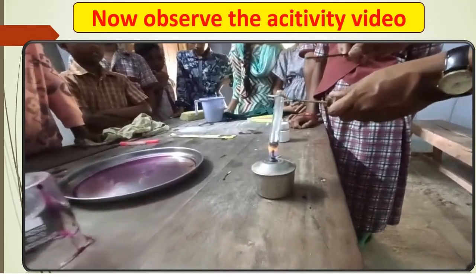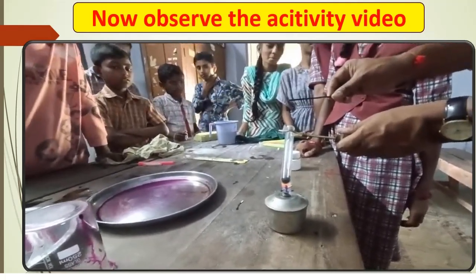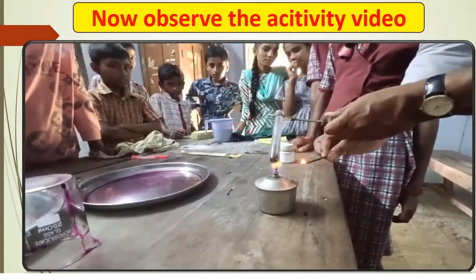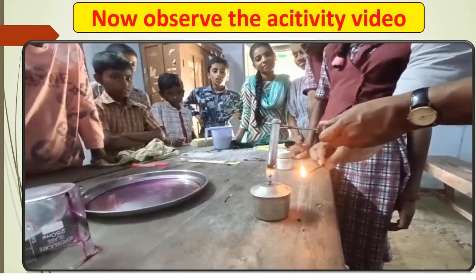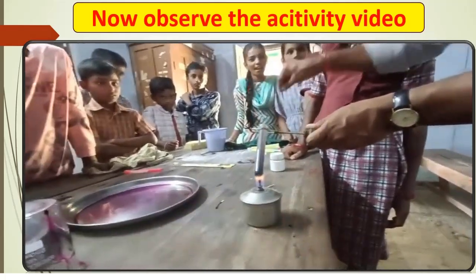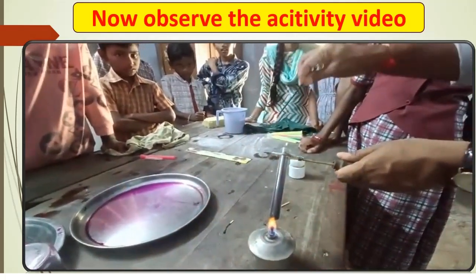So now here, take an agarbatti and light it, keep it aside for 10 seconds, then insert the agarbatti. Now here observe carefully. Insert the agarbatti with the burning end at the mouth of the test tube. So what happened? It glows. So which substance helps it to glow?